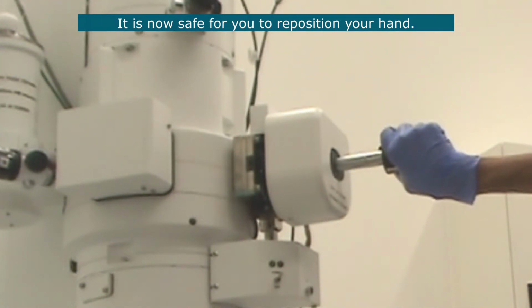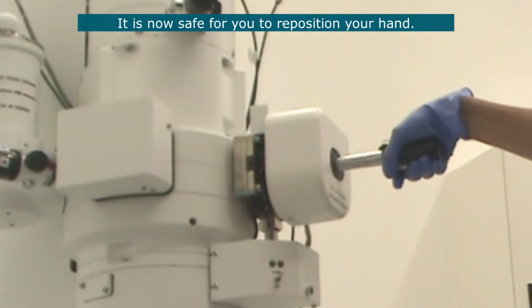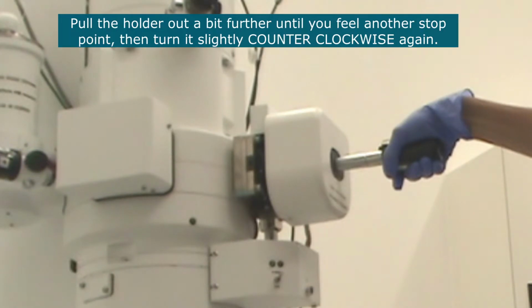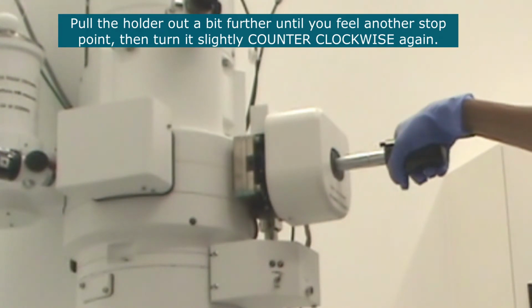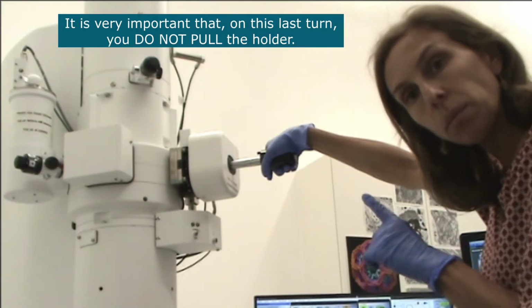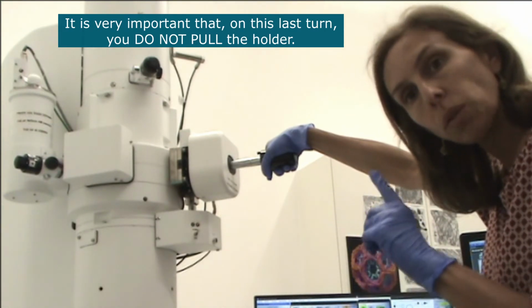It is now safe for you to reposition your hand, and you will pull the holder out a little bit further, and then you'll feel another stop point, and then you will turn it a little bit counterclockwise again. It is very important that on this last turn, you do not pull the holder.